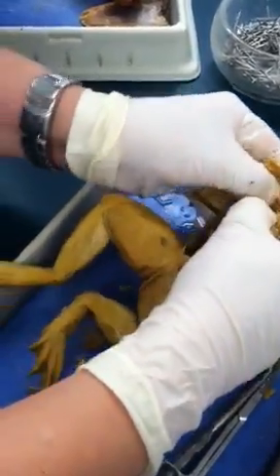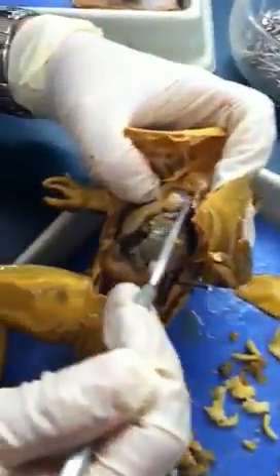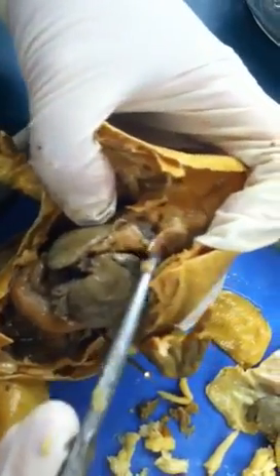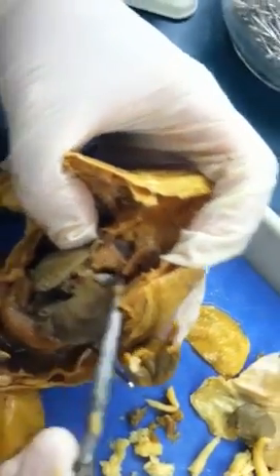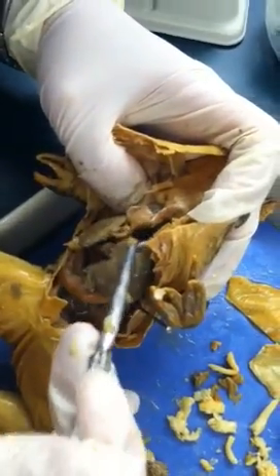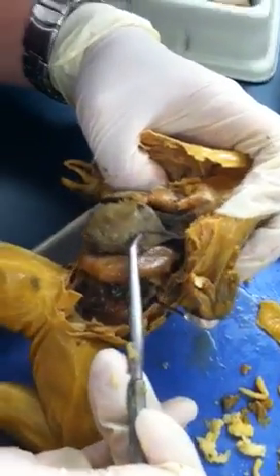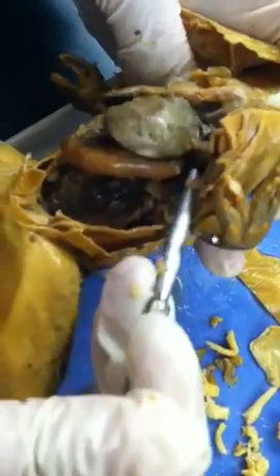Here is a very good view of the heart. For frogs, the heart has two atria and one ventricle on the bottom. You can see the two atria — they're kind of darker in color — and the ventricle on the bottom. On the side of the heart, you will see this organ that looks like a sac but has a different texture than the liver — that's the lung.